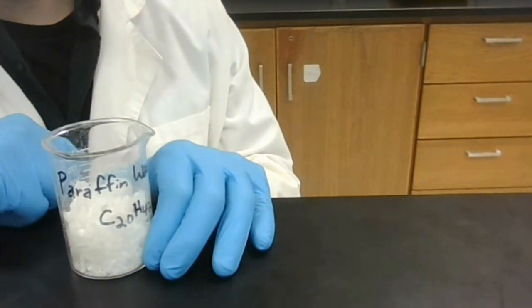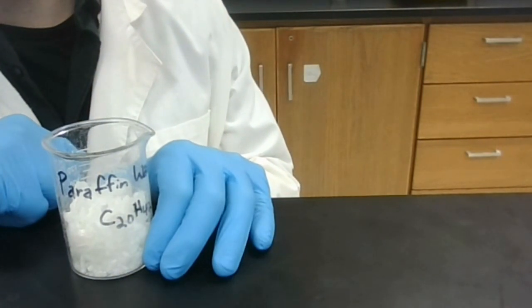For instance, are all non-polar covalent compounds hard? Or do all polar covalent compounds melt? I'll be running through these tests one by one for 6 different samples, and I'll guide you through the results every step of the way. For the first test, I will be performing a hardness test.